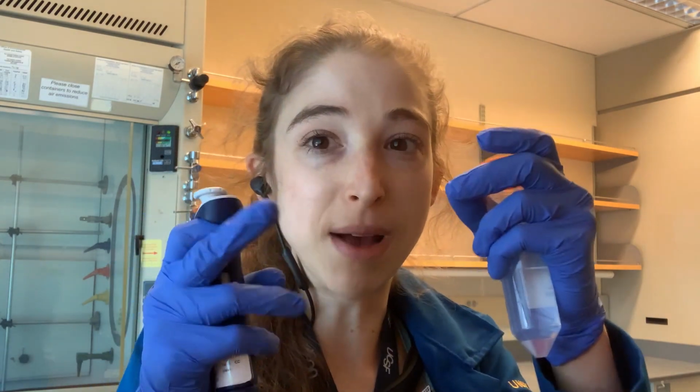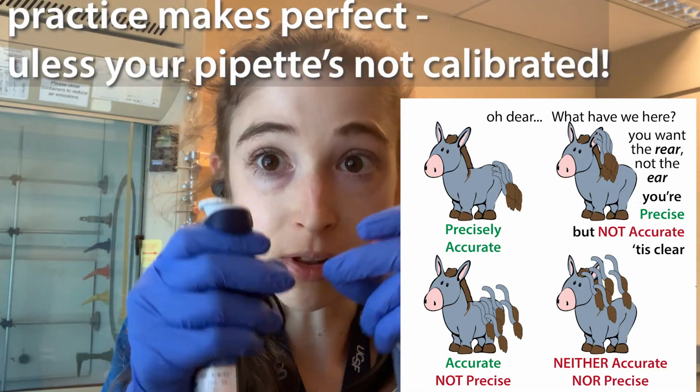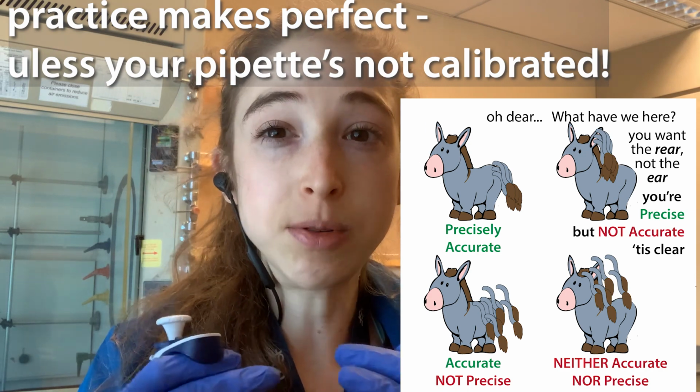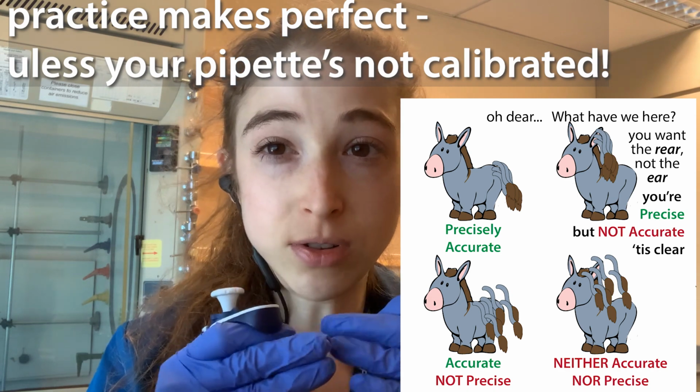First, you can be really shaky when you're pipetting. A good way to practice is just pipetting water onto a balance, and seeing that you're getting the same amount each time. That amount you can then calculate: does it really match the density of the water, or am I really pipetting the volume I think I am? It might not be your fault if you're not. If you were to test this, how close together each of those different tests were would be a measurement of your precision. So how close together the values are.